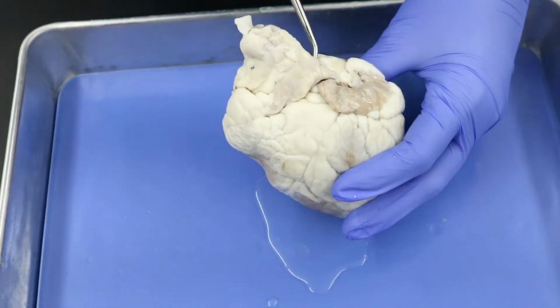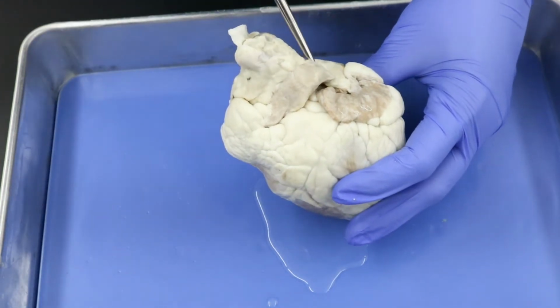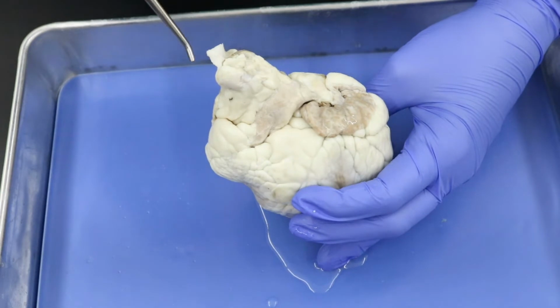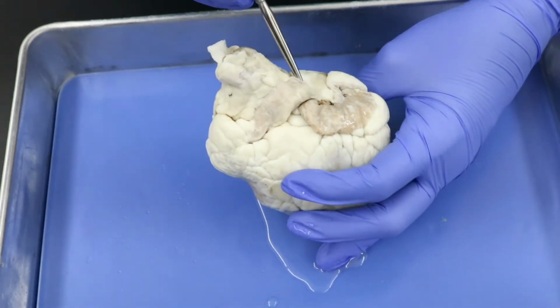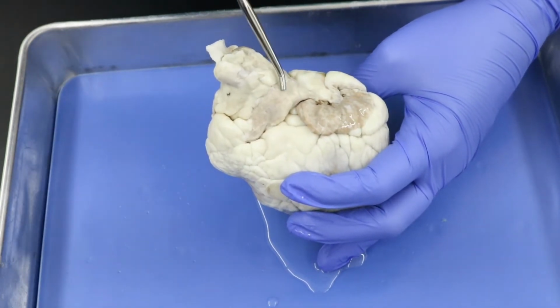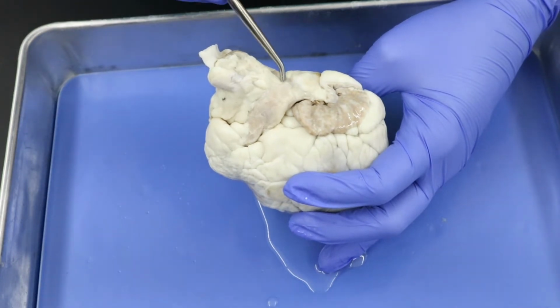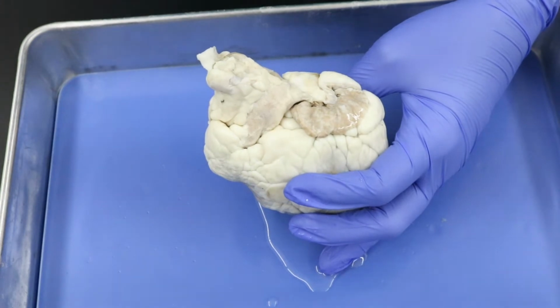So vessels that go away from the heart are called arteries. So this here, I'm going to tip it a little bit so you can see the opening. This here is going to branch into our right and left pulmonary arteries. Now, they've been cut too low here for us to actually see them. Some of you will have them visible on your hearts, and so we want to make sure we know where those should have been, even if you don't have them, okay?